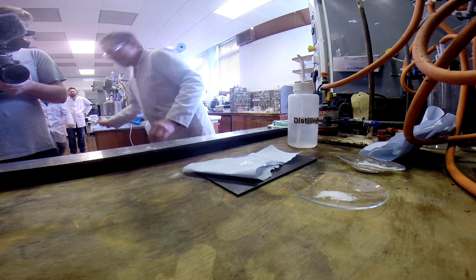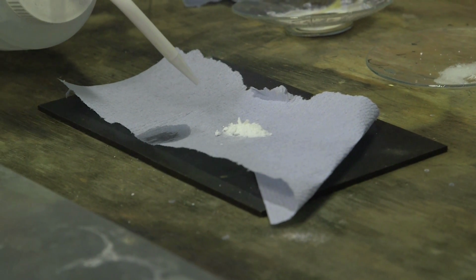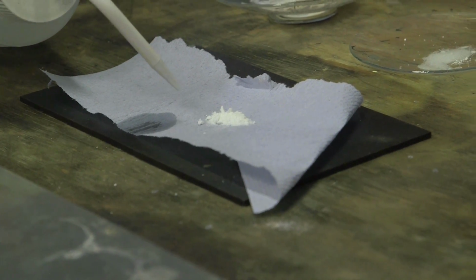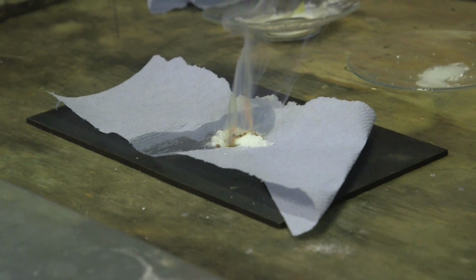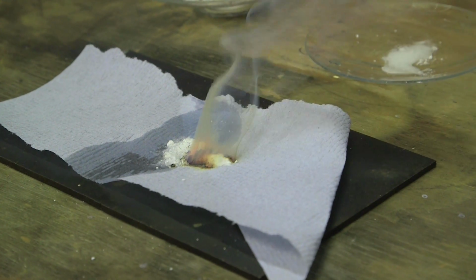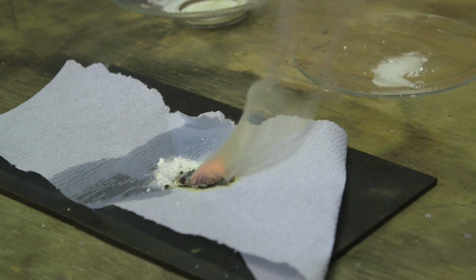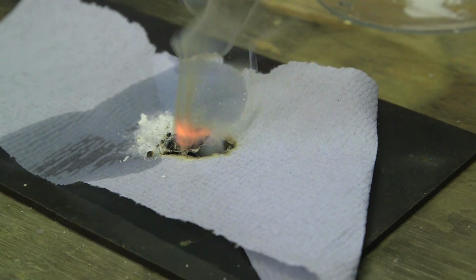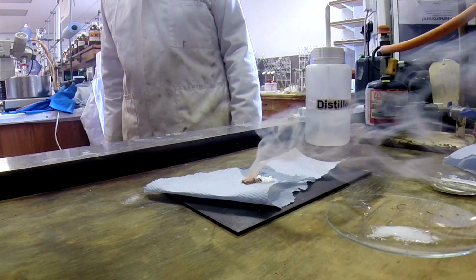Thank you, Darren, for that. We need to get just the right amount of water in it to initiate the reaction. So I'm just putting a few drops, and what I'm hoping is that that will run through the capillary. There you go. So we do get a fire out of it, but I guess you probably could manage with that fire, and it's nowhere near the same horrific quantity of energy coming. You can see it getting very hot in the middle, so I strongly advise you to not do this on the end of your finger, because it would cause severe burns.